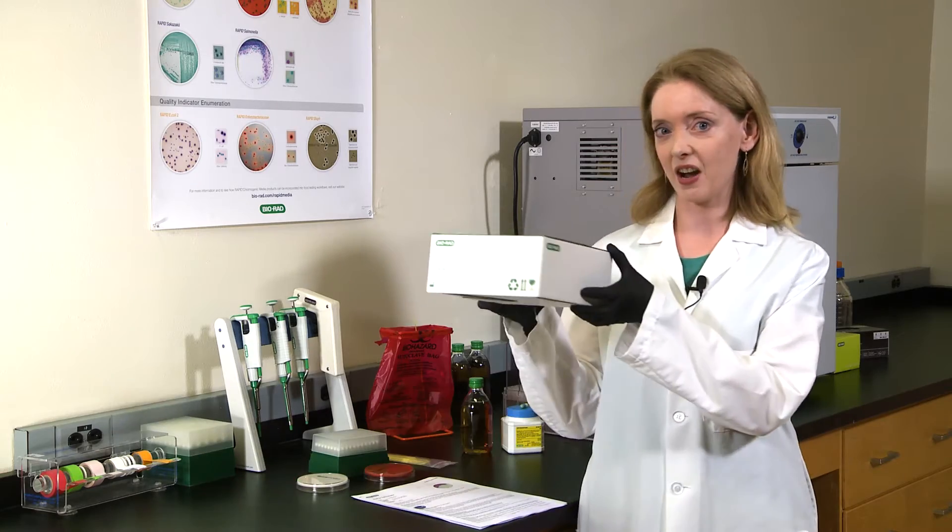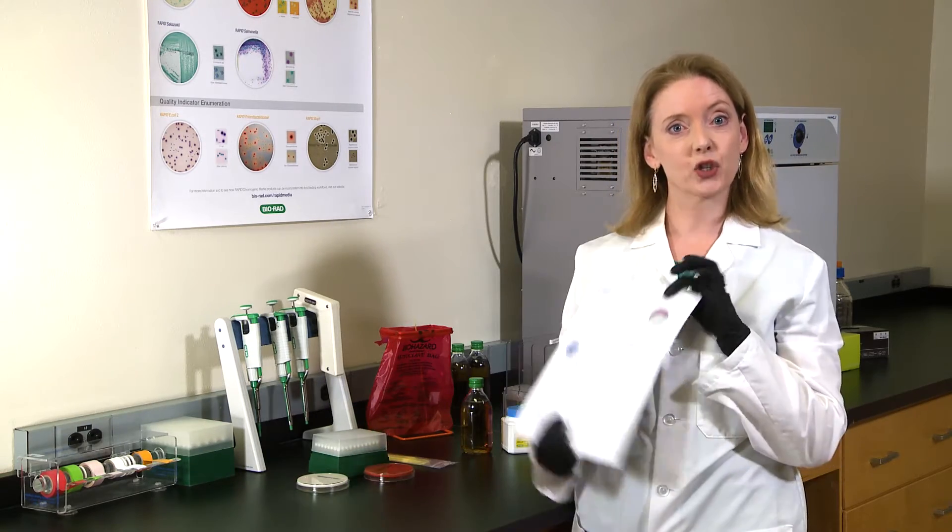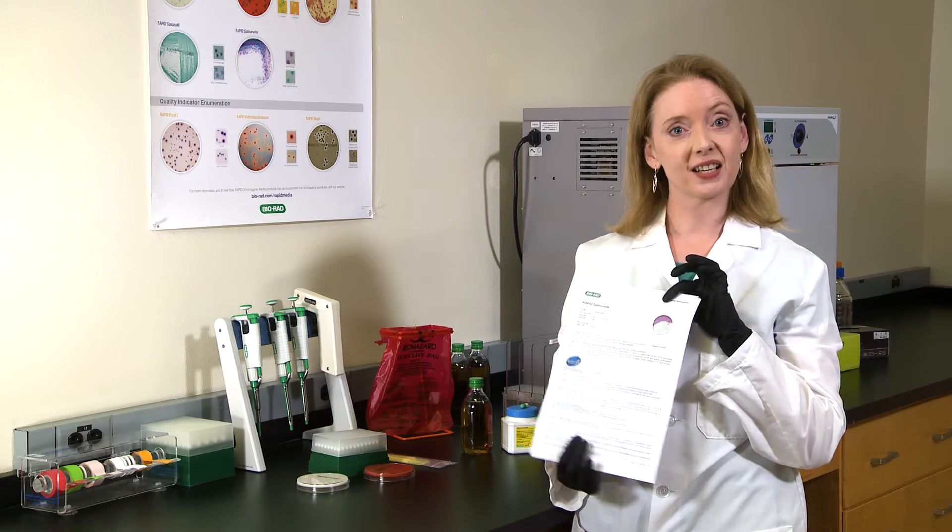I'm here in the food microbiology lab and I have ordered and received my ready-to-use plates. Here they are. Plus I've got my handy technical sheets so I don't forget what to do next.